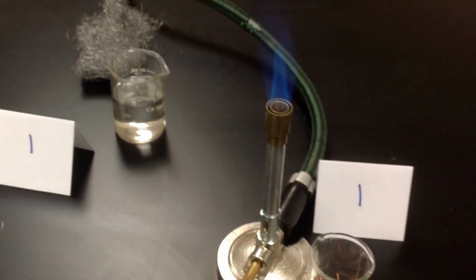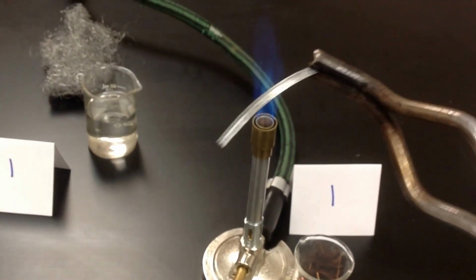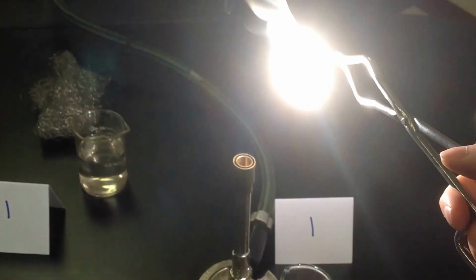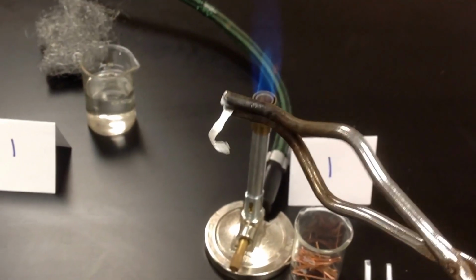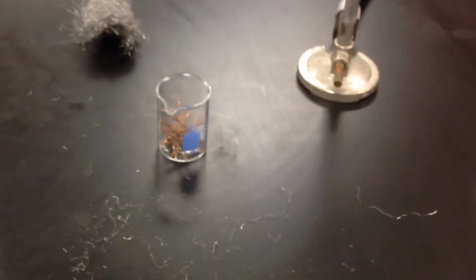Okay. The next bit of lab is what I would demonstrate in class, where we have a piece of magnesium metal. So magnesium looks like this normally. And then we're going to go ahead and burn it. Now, when this burns, it's going to be very white, bright. And that's what it looks like afterwards. Okay. So now I'm going to turn my Bunsen burner off, and we're going to go to the next station, station 2.